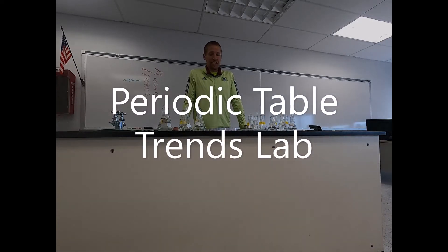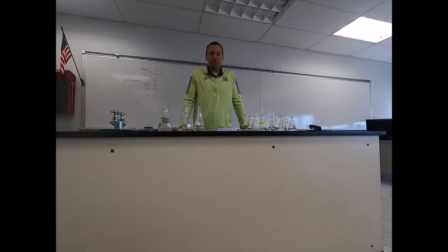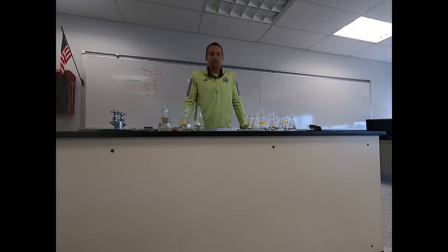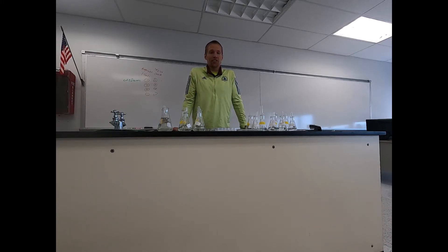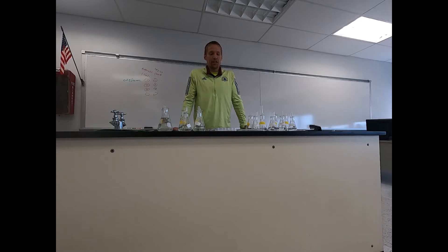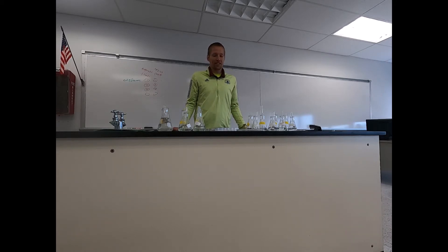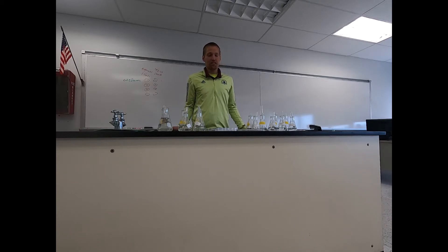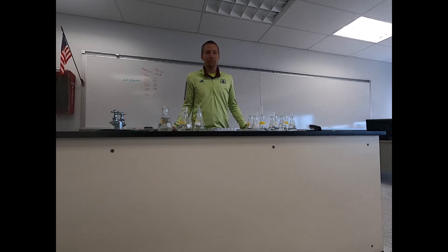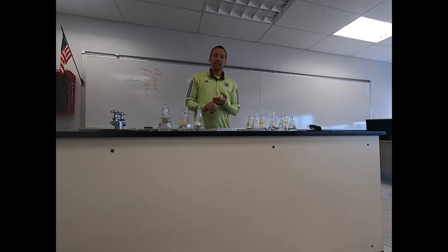Hello, and today we're going to be looking at periodic table trends through a couple of lab activities. First, we'll react a few different metals with water and hydrochloric acid. Then we'll work with our alkaline earth metals in various compounds — chlorides — and see how they react with a few different compounds as well. So we'll go ahead and get started with the metals of magnesium, calcium, and aluminum.